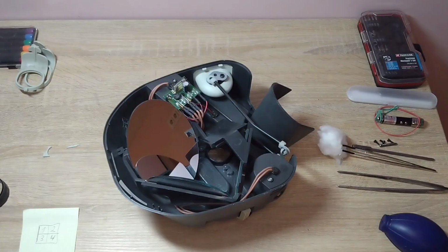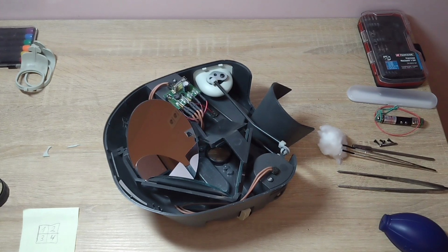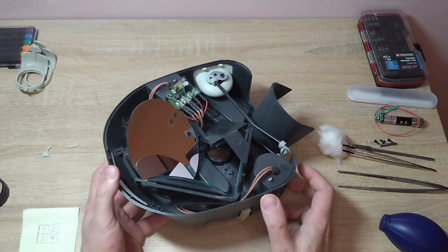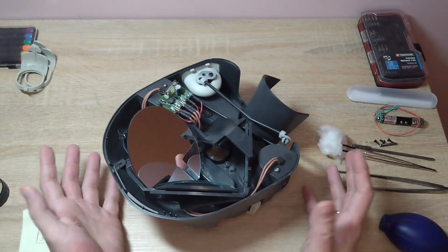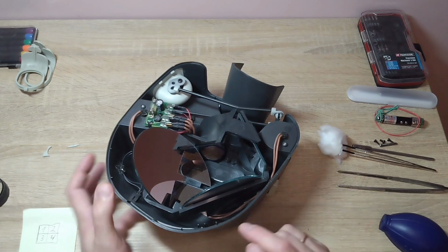Well, let's continue. I blew air on the optics. However, that was not enough. There is still a slight haze left on the mirrors, and I wiped it all slightly with cotton. There is very little information about this microscope. I found a video on the internet. It dates back to around 2012. In that video, from 2012, they also disassembled such a microscope and wiped the mirrors with cotton.